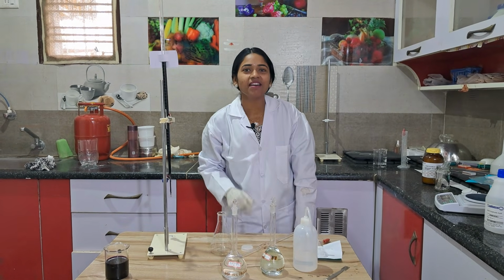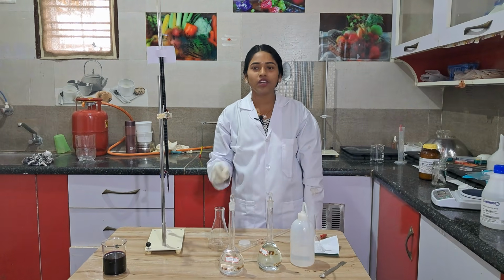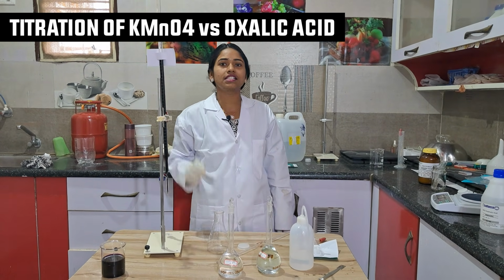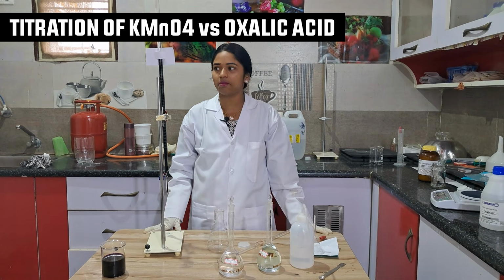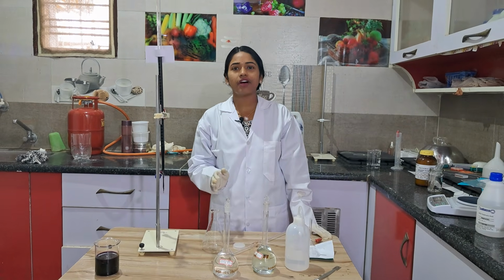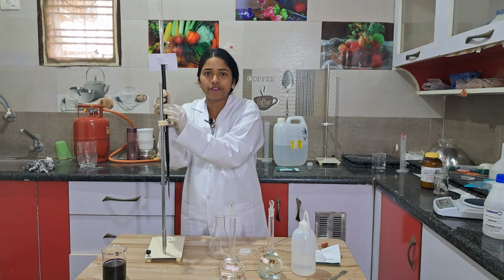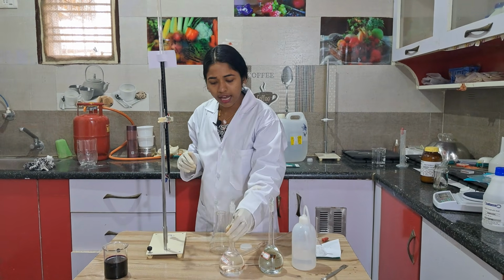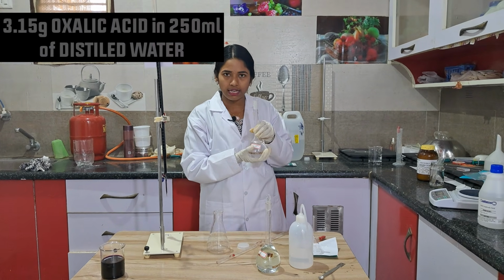I'm Komali Mam. In today's session, I'm going to do the titration of KMnO4 versus oxalic acid experiment. The use of titration is that we can find the concentration of an unknown solution by using a known solution. Here, our known solution is oxalic acid.